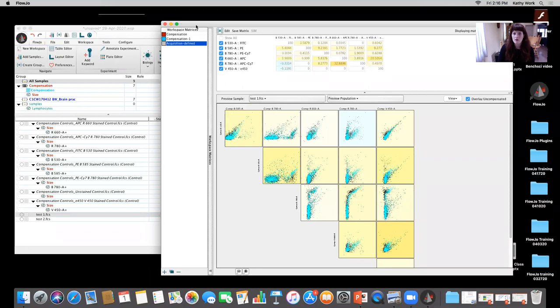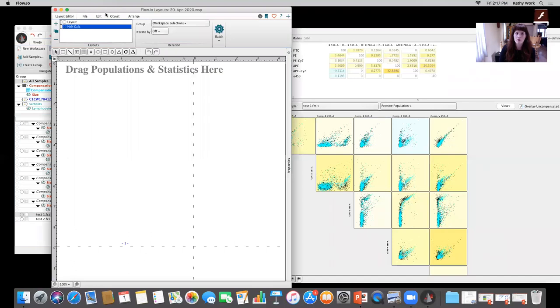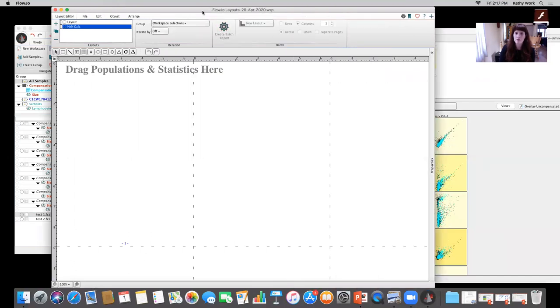So based off of the acquisition defined, what we can do is really take a close look with these N by Ns and ask, where are we seeing this problem with the experimental file itself versus the controls, and why am I having this problem with over or under compensation? If you joined in on previous sessions, you'll know that we have the layout editor, where we can go ahead and take a look at N by N plots.